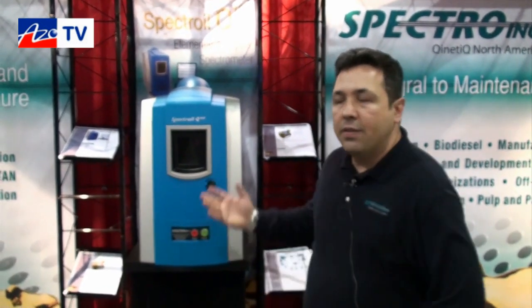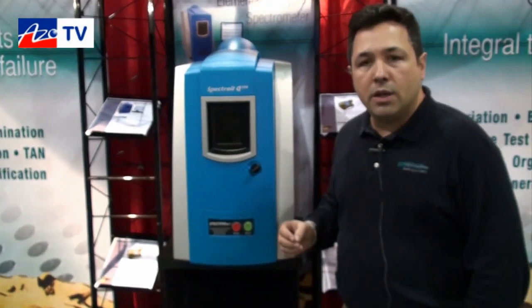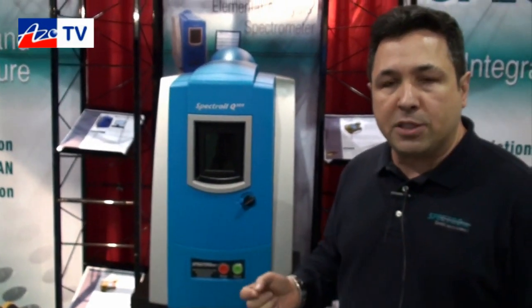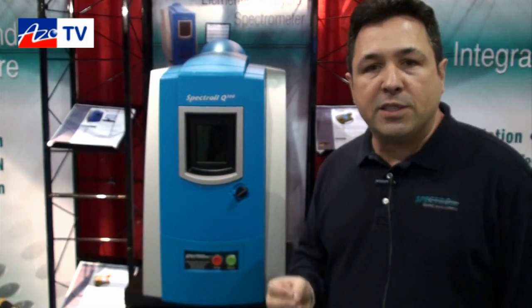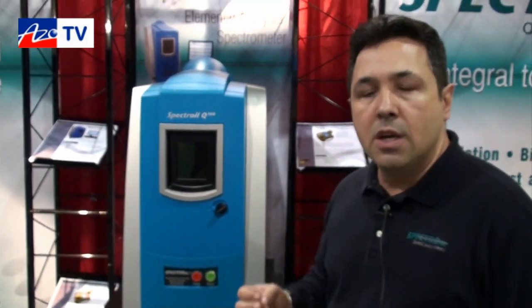Good morning, thank you for your interest in Spectro Incorporated instruments for oil analysis and fuel analysis. This is our Spectro Oil Q100. The Q100 is the latest instrument in the Atomic Emission Spectroscopy field that is specifically designed from the ground up for used oil analysis.